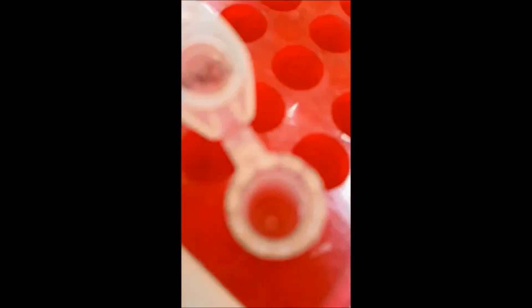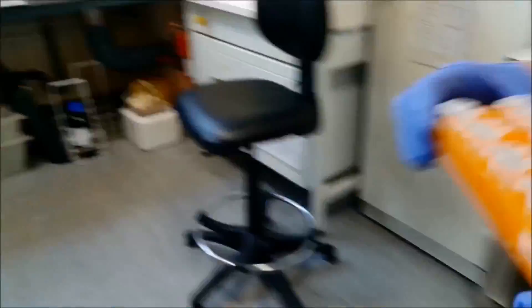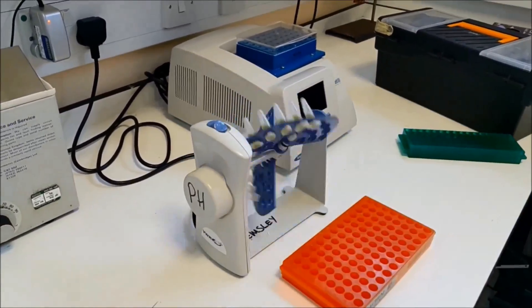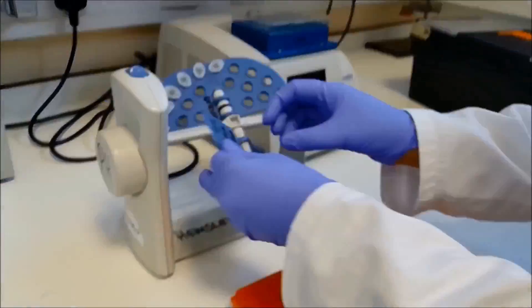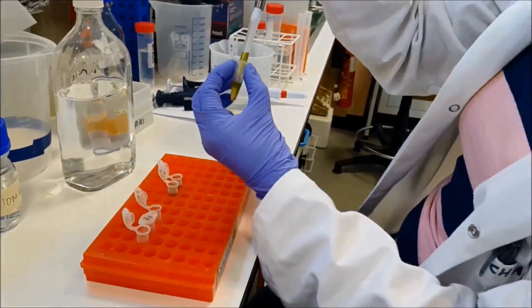Then we add some tiny beads that will stick to the part of the protein where the chemical switch has been removed. After an hour, the beads are gently washed multiple times to remove any proteins that have not stuck to the beads.